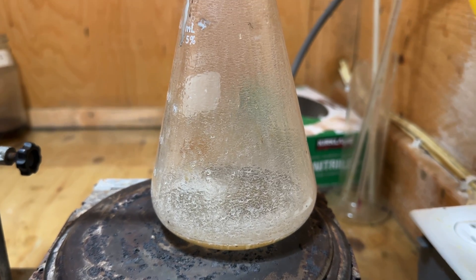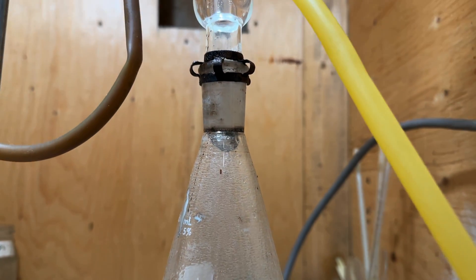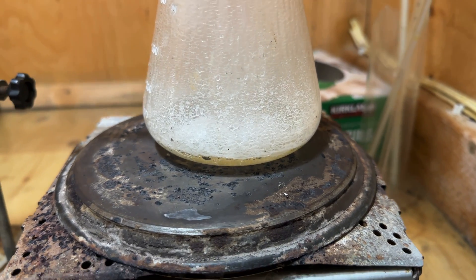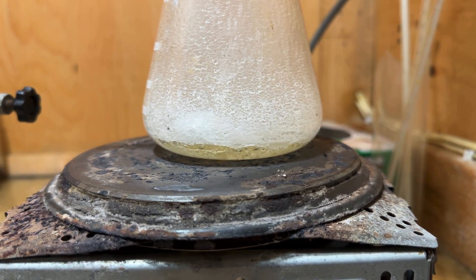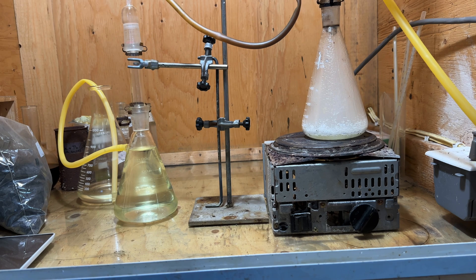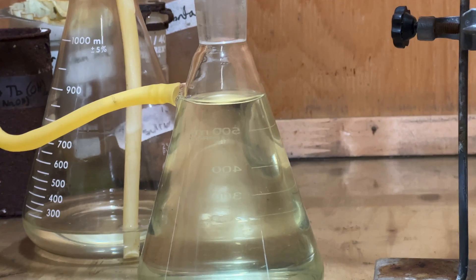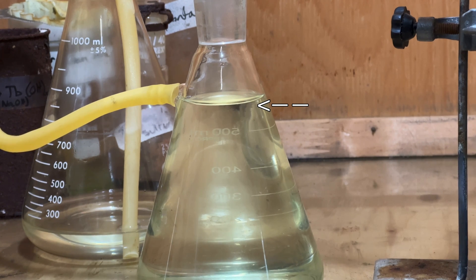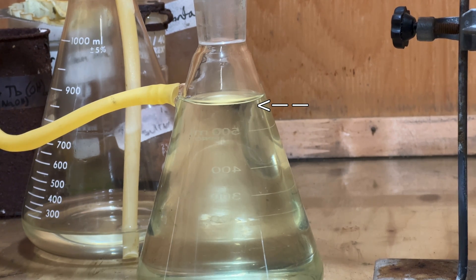Despite strong refluxing, the reaction proceeded slowly and took several hours to reach completion. A white material slowly formed in the reaction flask, and the mixture became quite viscous. At one point, suck-back did occur, but fortunately the suck-back trap prevented the water from entering the reaction mixture. After this point, it was actually possible to directly observe the hydrogen chloride dissolving into the water, which was pretty cool.